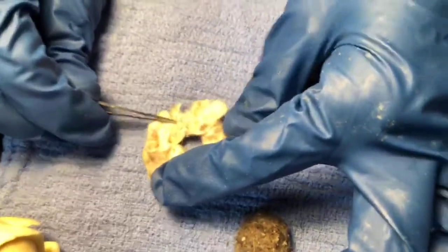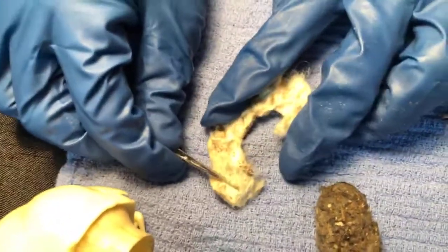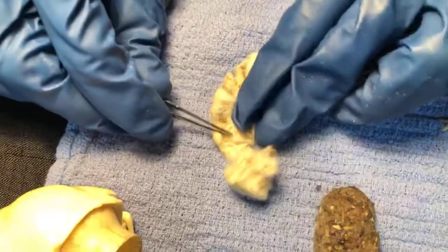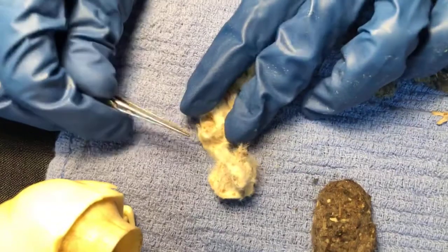Yeah, so you'll see here in the hawk one, see any bones here? So there aren't any bones in there. So it's a big chunk of fur for the hawk. Big chunk of fur. And the bones, is that because he has picked around the bones, or just that his stomach was able to digest them? His stomach was able to digest them.